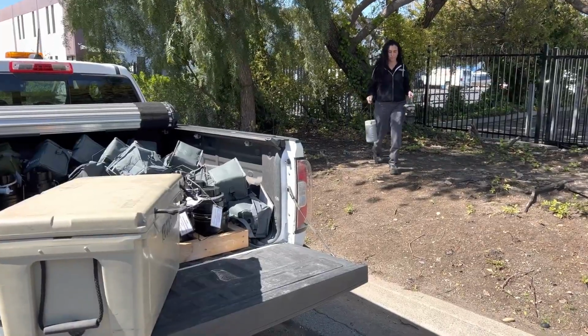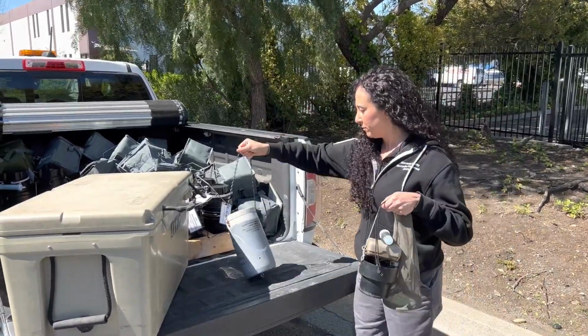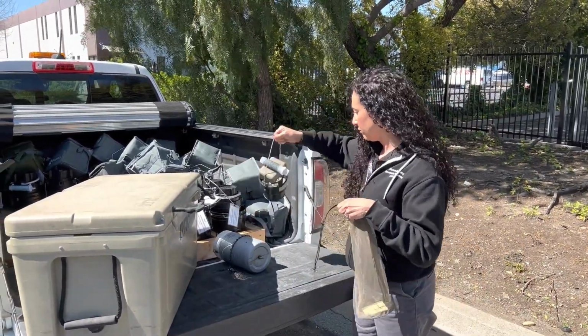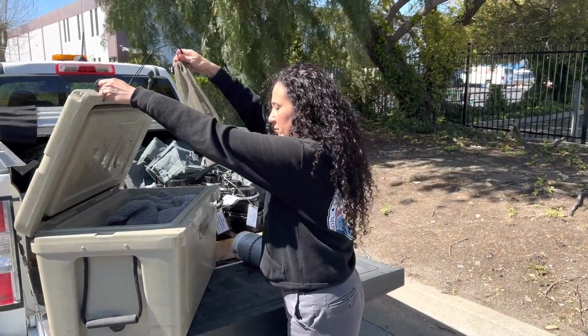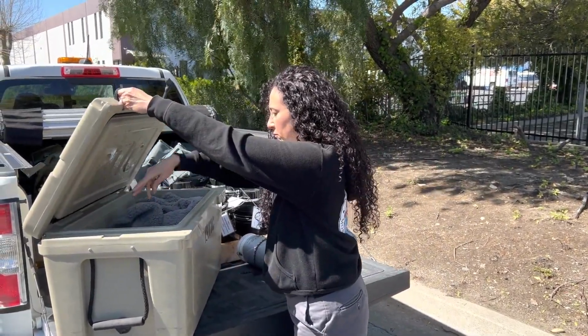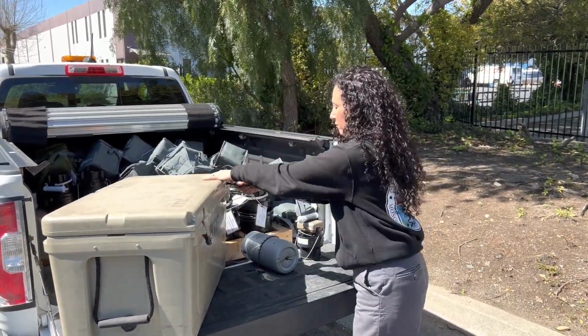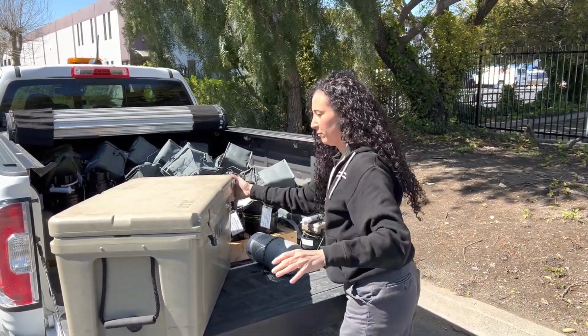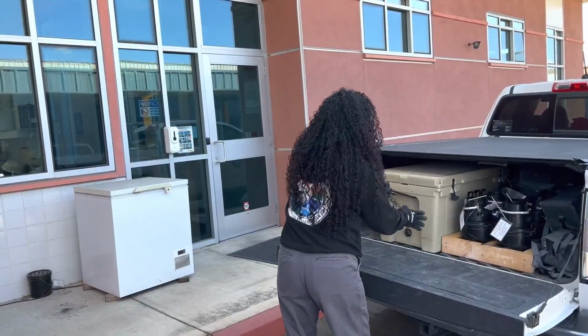Place the trap net that contains live mosquitoes into a large ice chest with dry ice to freeze the mosquitoes and preserve any potential pathogens. Alternately, you can place the net with mosquitoes into an insulated container, such as a large cooler, to keep them alive while you transport them back to your facility. If you keep them alive, ensure that you protect the mosquitoes from extreme heat or desiccation while in transit.